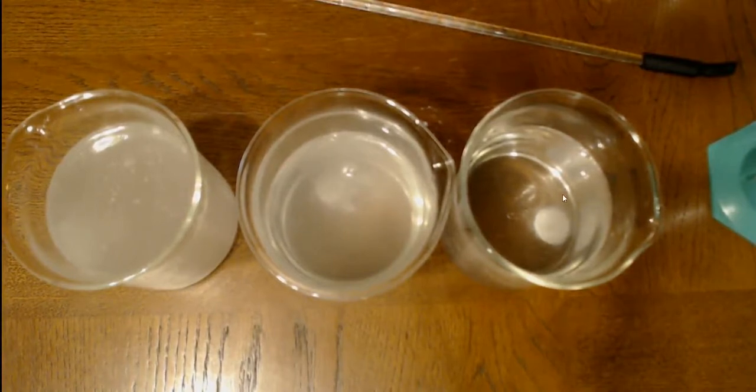So, basics of concentration. If you spread things out, it's harder to react because in order to react, the molecules have to come together. So it's harder for them to come together when there's less molecules around. So there we can kind of see our antacid still.